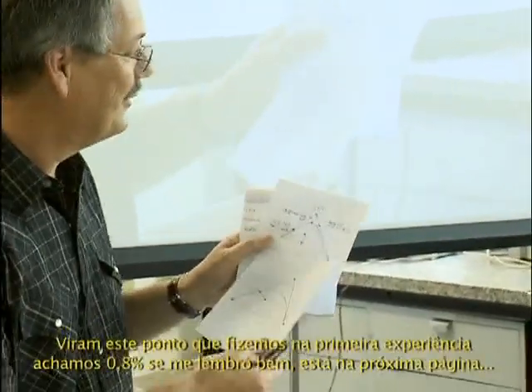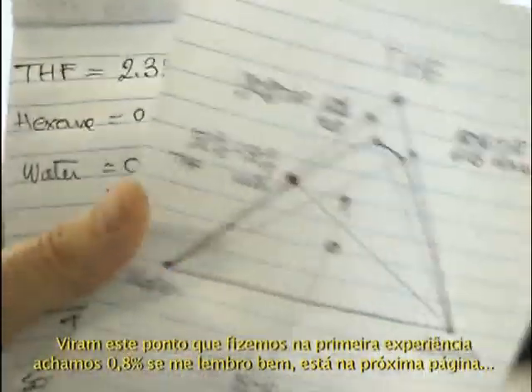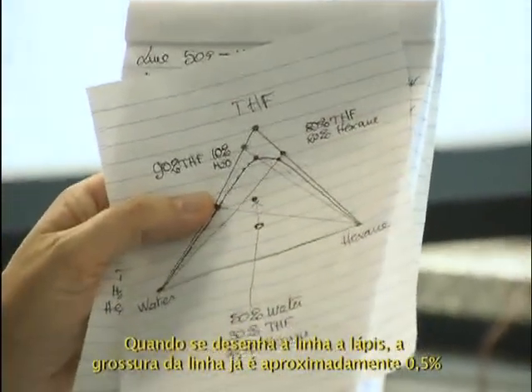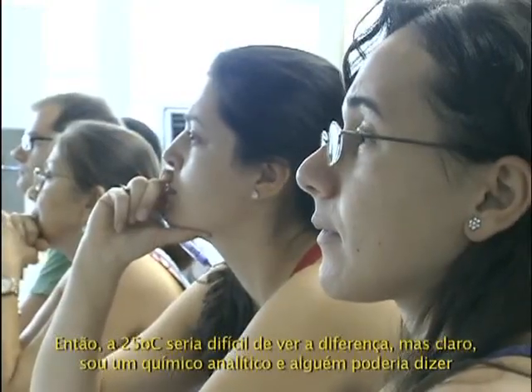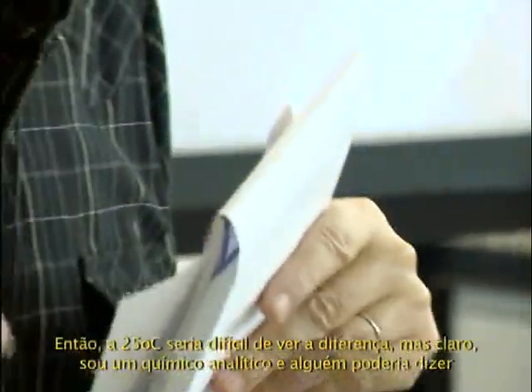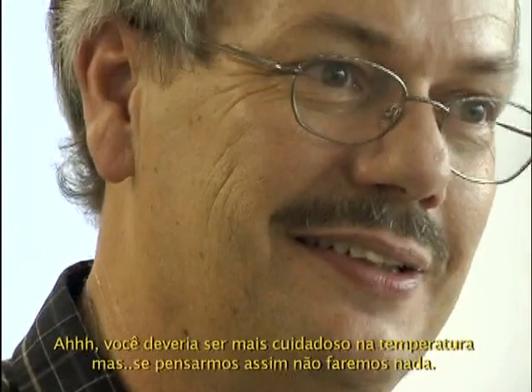Why? You see this dot we did on the first experiment. We found 0.8%, if I remember. That's the next page. We found 0.8% hexane. When you draw the line with your pencil, the line itself is approximately 0.5% wide. So at 25 degrees, it would be difficult to see the difference. Of course, I am an analytical chemist. A PChem chemist would say, wow, it should be very carefully regulated in temperature. But if you work that way, you cannot do anything.